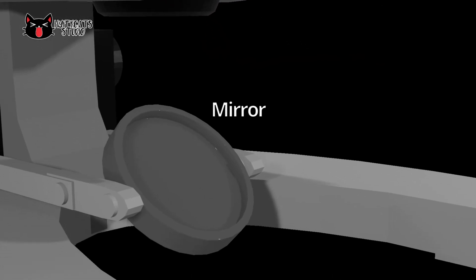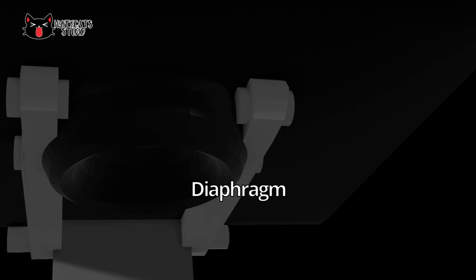The illuminator on this microscope is the mirror that captures light from a light source like the sun. Lastly is the diaphragm, also known as the iris of the microscope because of its role to control the amount of light that reaches the specimen.